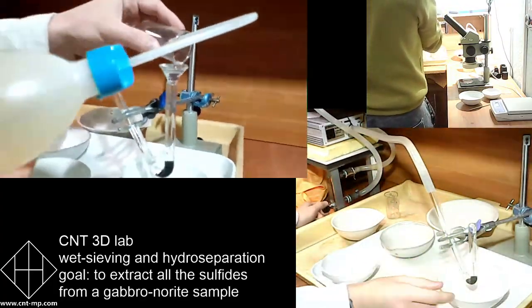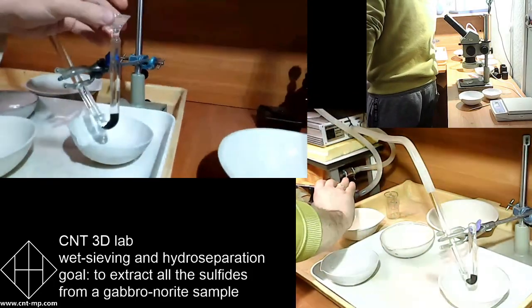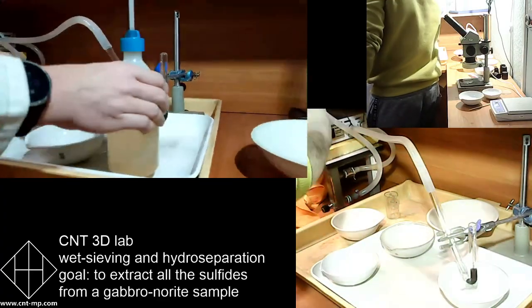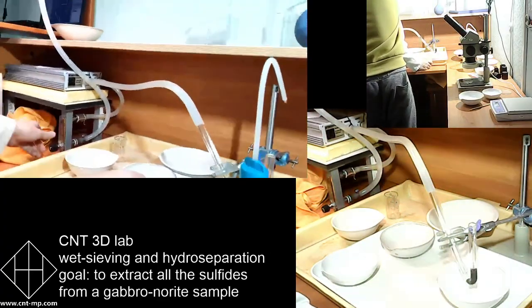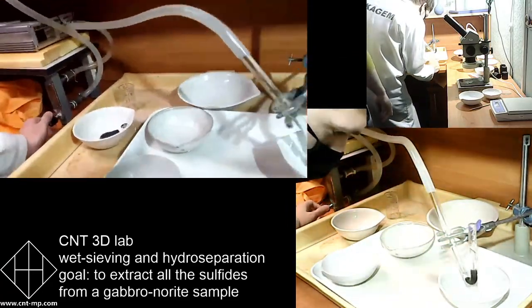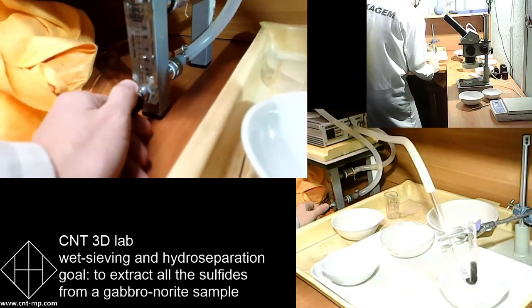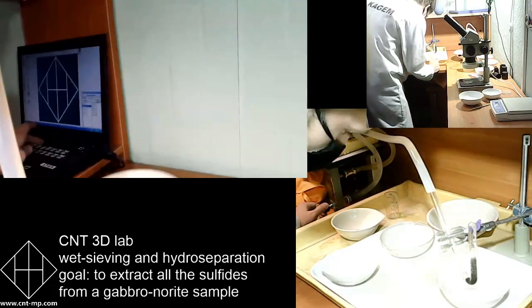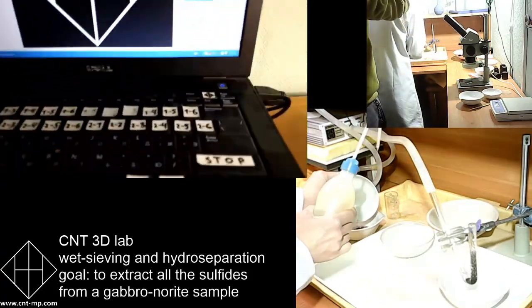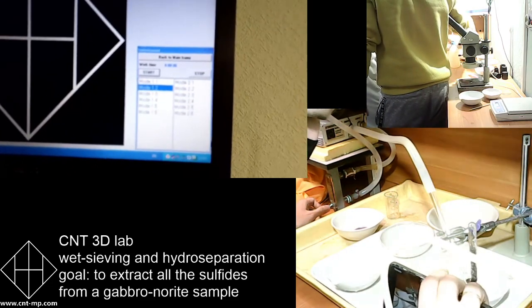So we place the glass funnel on top of the glass tube and pour the material through this funnel inside the glass tube. This is how the hydroseparation process is loaded by the fraction, sorry, each time. It's not easy to see though. Guys, your camera is shaking a little bit. Anyway, this time we are using a short glass separation tube.